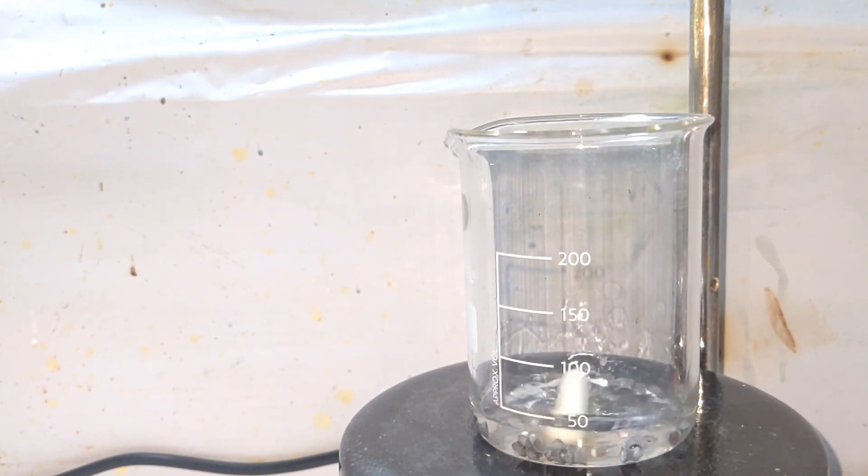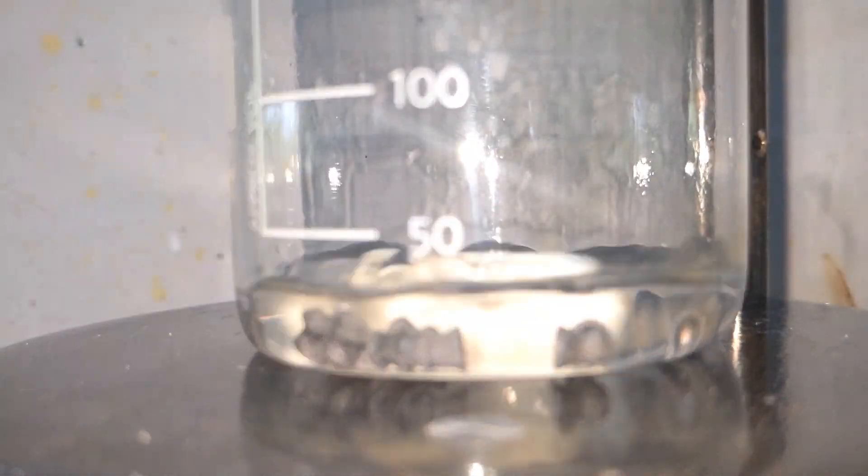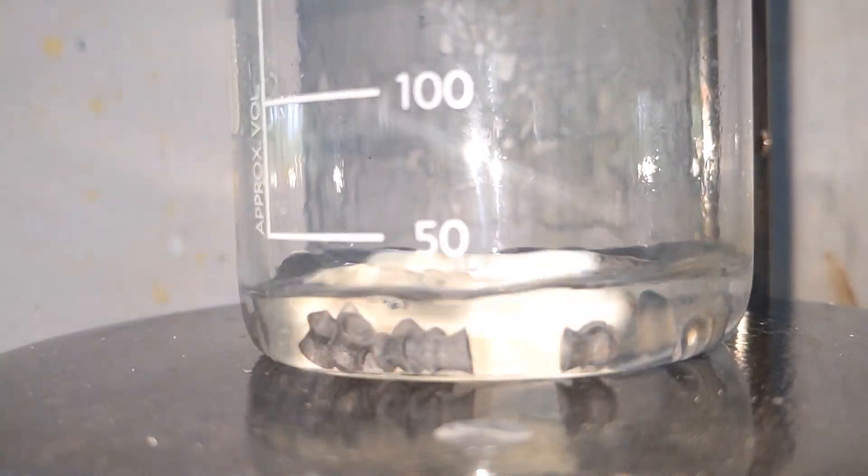You can very well notice that there is no reaction with glacial acetic acid. Even if you place it for a day nothing is going to happen.